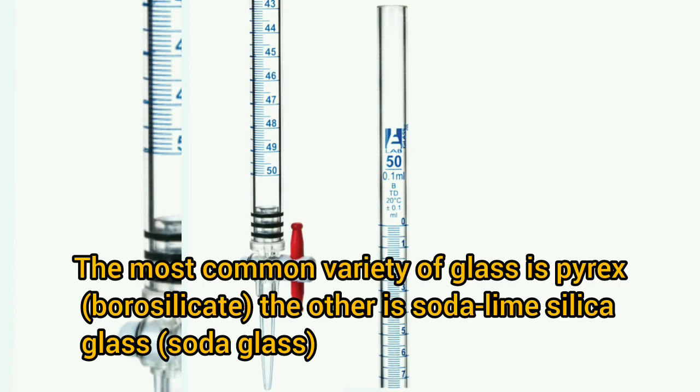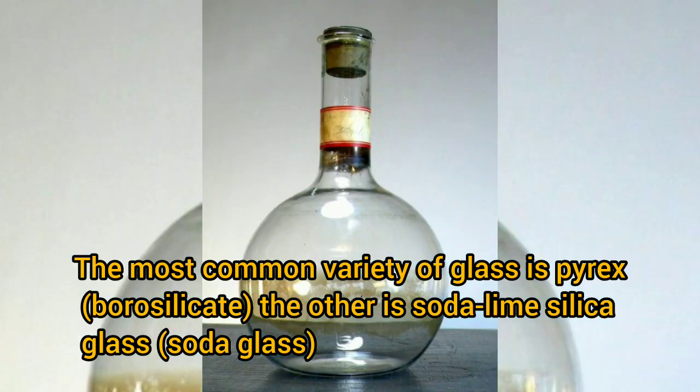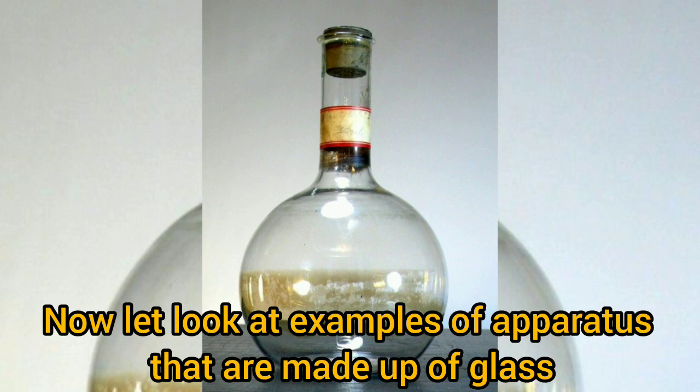The most common variety is the one we call borosilicate. And another one is also called soda glass, which is also known as soda lime silicate glass. Now let's look at examples of apparatus that are made up of glass.